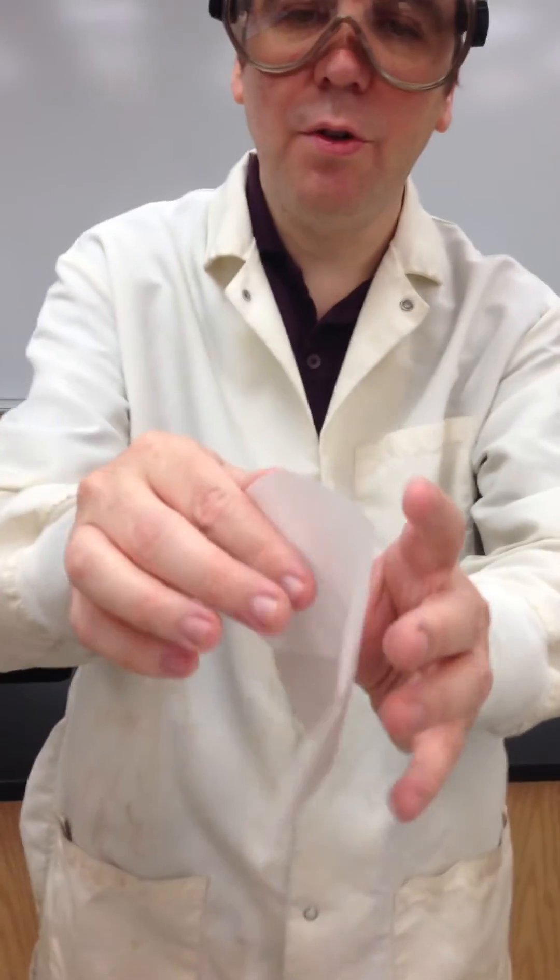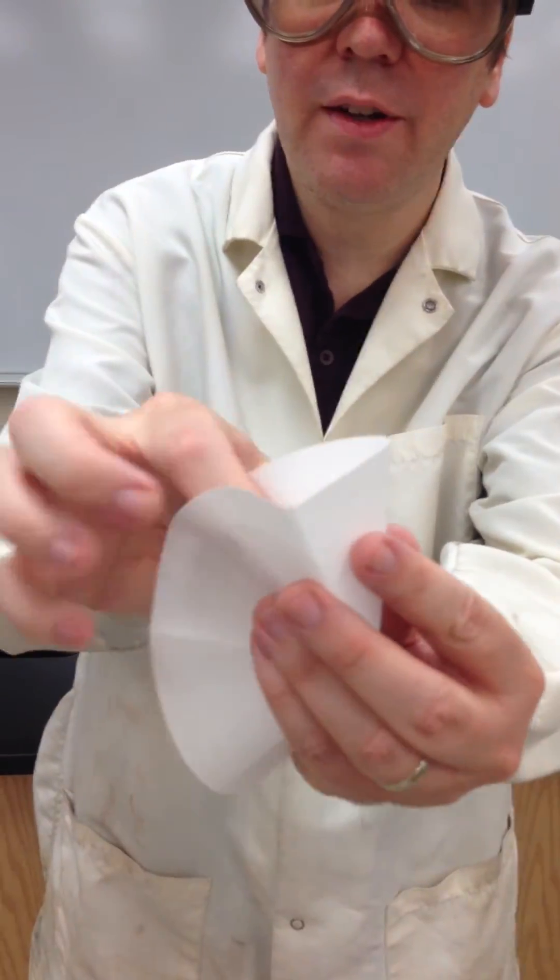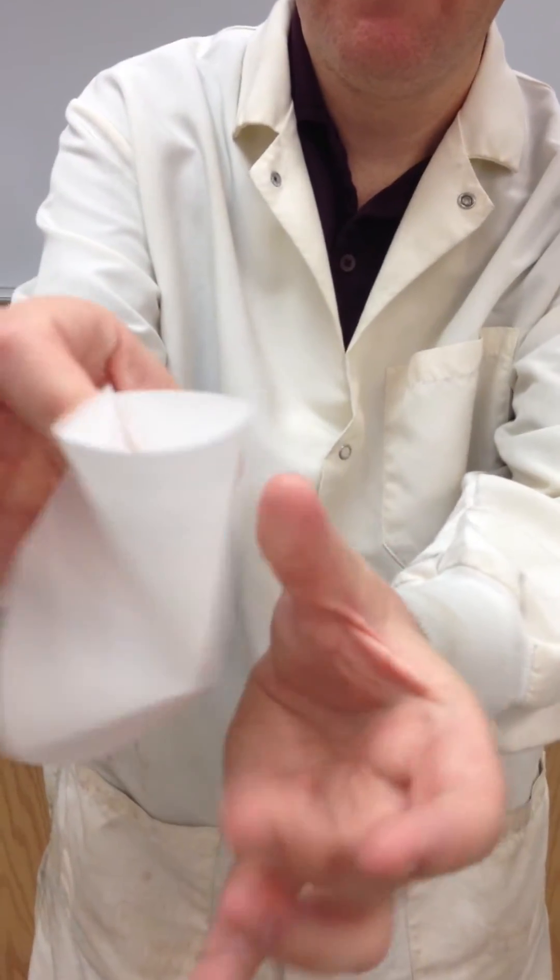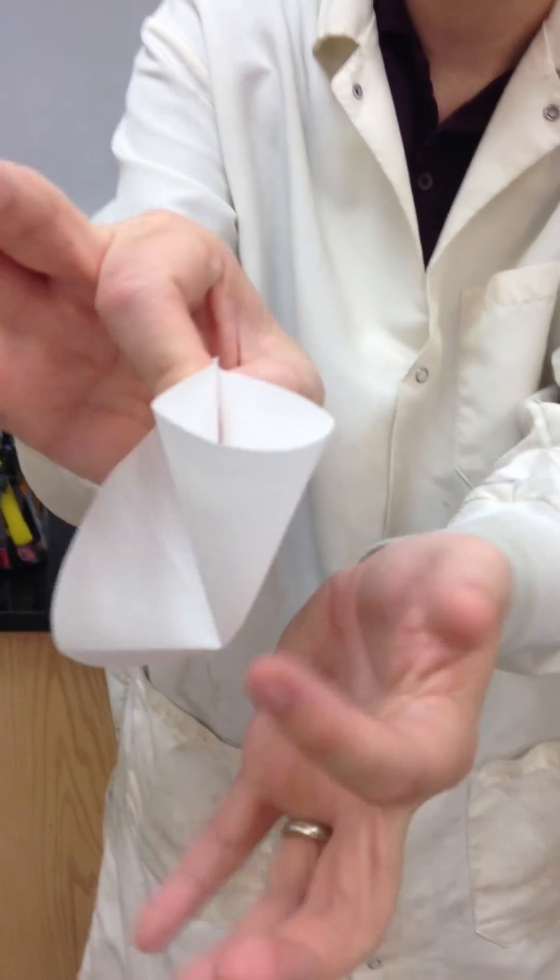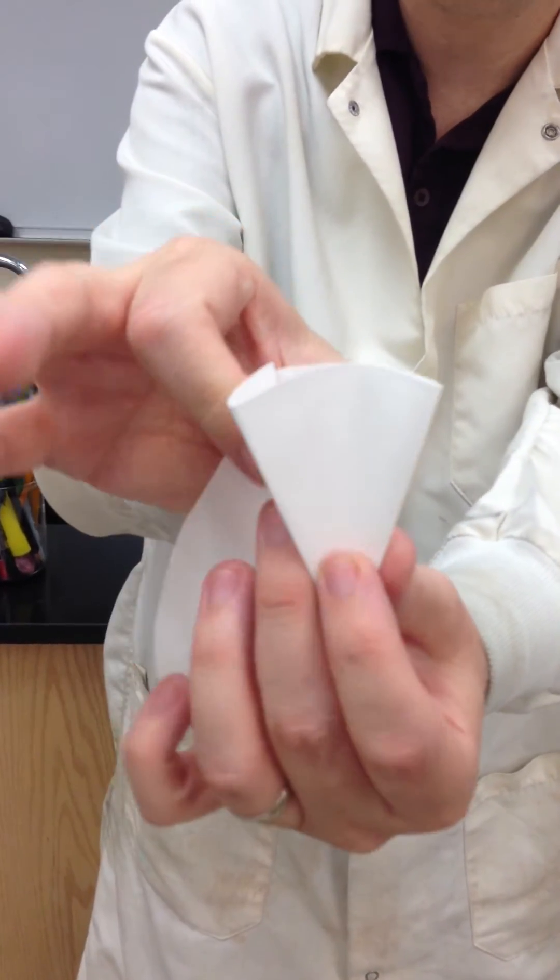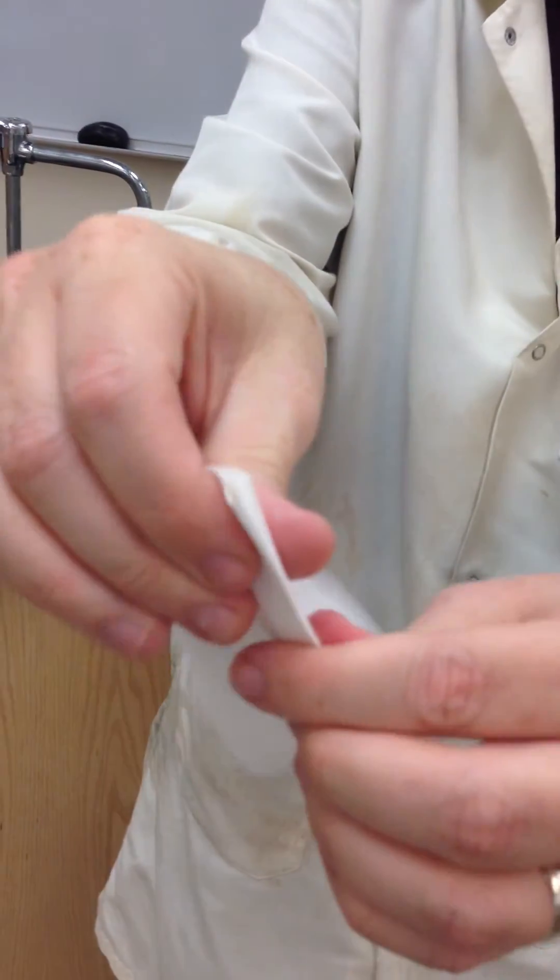The next thing I'm going to do is take a single sector. It looks like this, one sector. Now I'm going to push that sector inwards and fold it in like a fan, just like that.